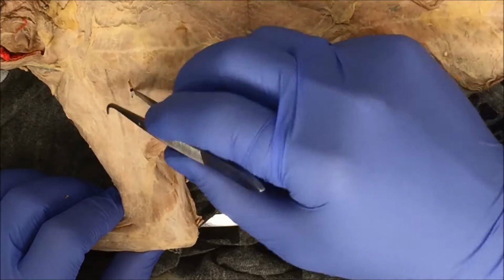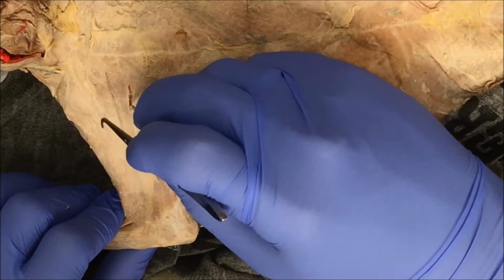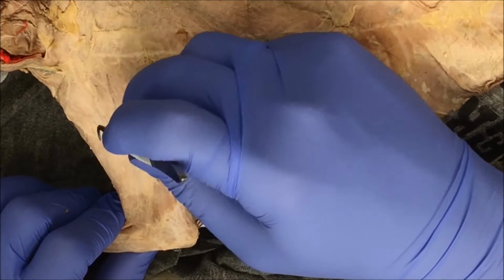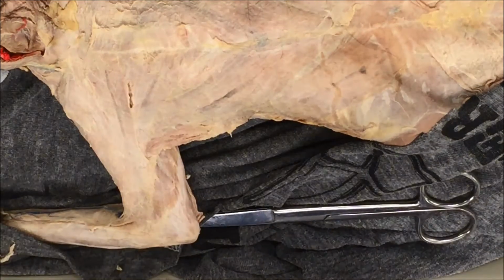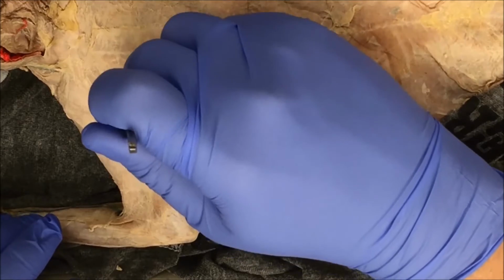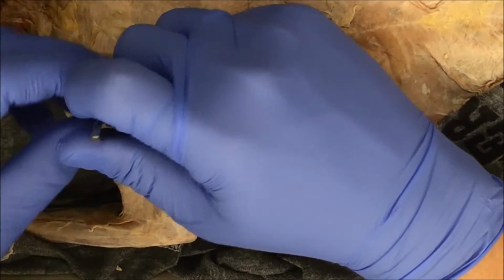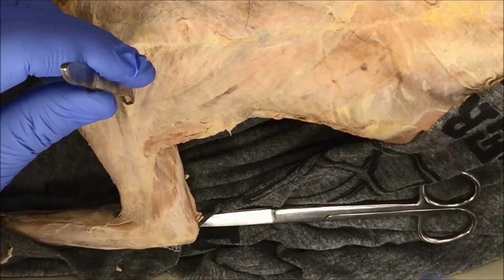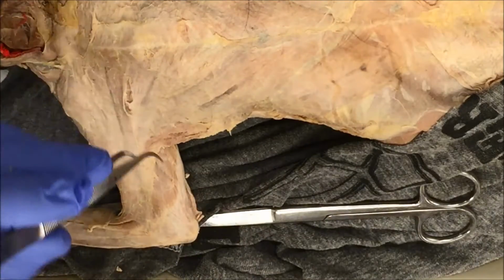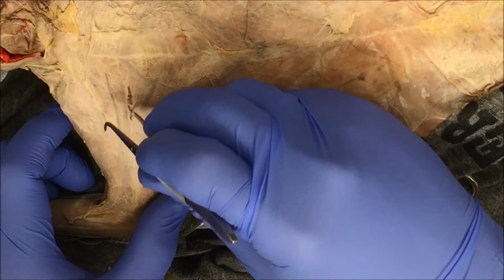I'll continue following in this direction because I can clearly see the line runs right through here. I'm just going to follow that line. Again, move some connective tissue. Now this time I'm going to use my scalpel. If you decide you want to use your scalpel, I would advise you to protect the underlying muscle with your forceps. Take your forceps, spread them apart, and if you can see the line, use a fresh blade scalpel and make that cut. That would be what I would recommend. So again, I'm just going to continue.